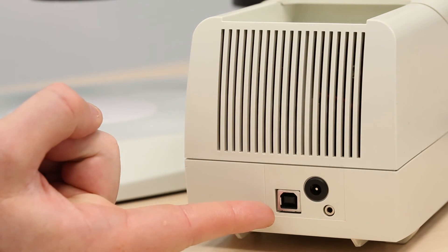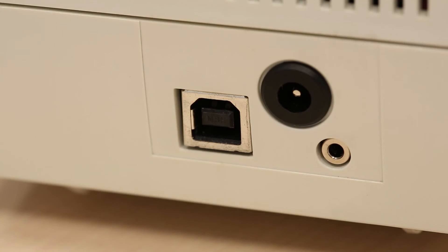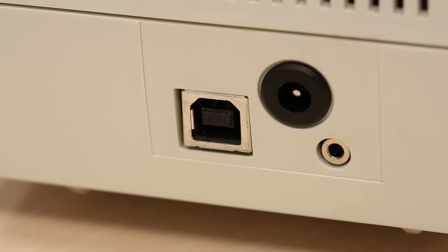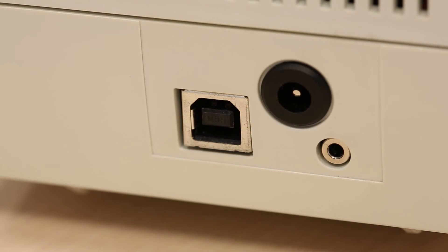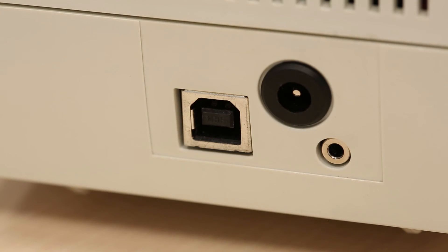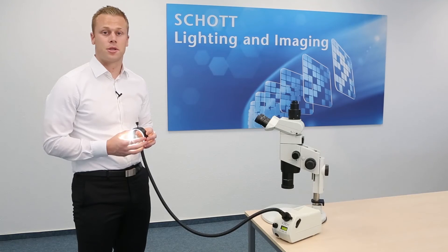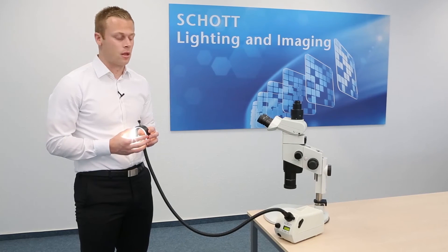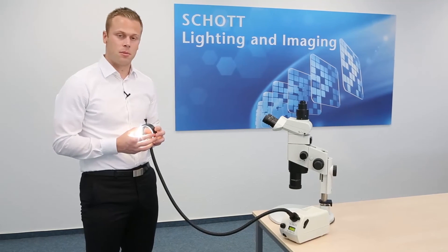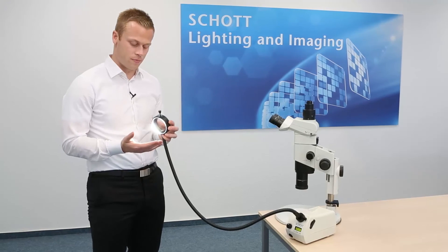Here is the port for the remote control. Next to the remote control port is also a port for the foot control, making this an ideal product for various applications. A flexible ring light can also be connected to this light source as you can see here.